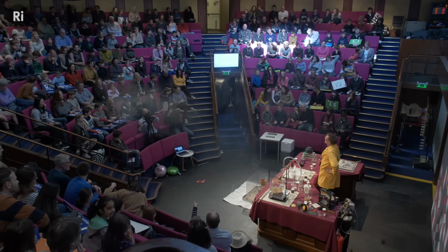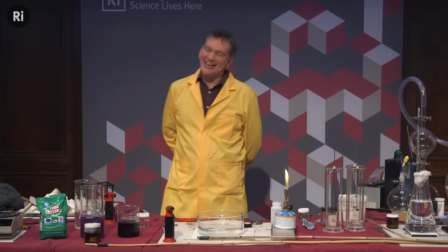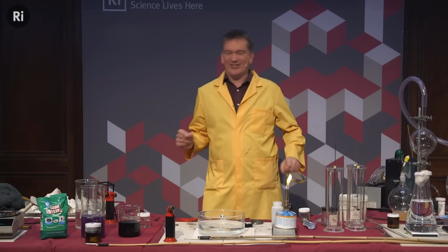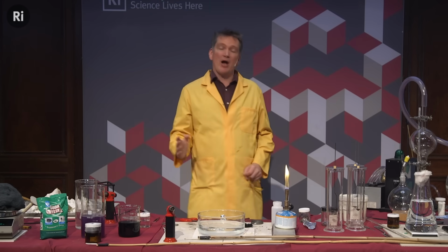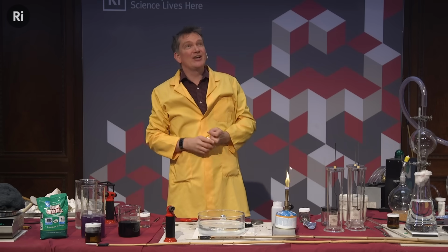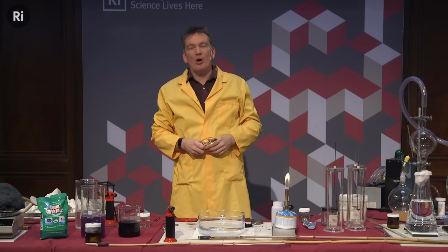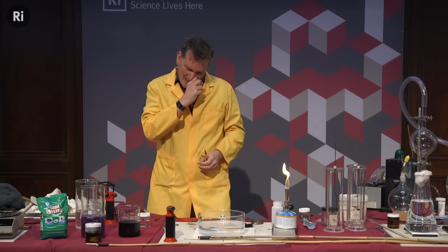Okay. Now, I particularly like doing that experiment. I think it's a really important one to do because this is one of the elements that is often shown at schools. In schools, it's on the GCSE curriculum. The teacher tries the little piece on the water there, as you saw, and you can hardly see anything, and then it's, go on, use a bigger bit, and then they say, okay, I'll use a bigger bit. And I tell you, I have heard so many cases where what's happened there is the sodium has been on the water and has exploded and then showered burning molten sodium everywhere, which sounds hilarious, unless you're one of the students getting coated in burning molten sodium.